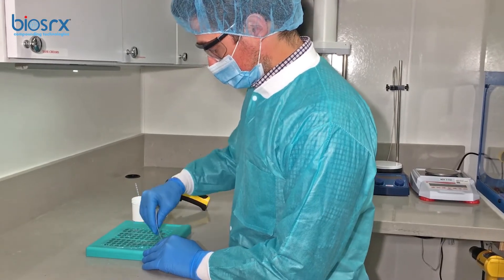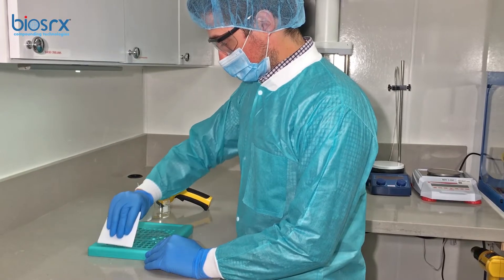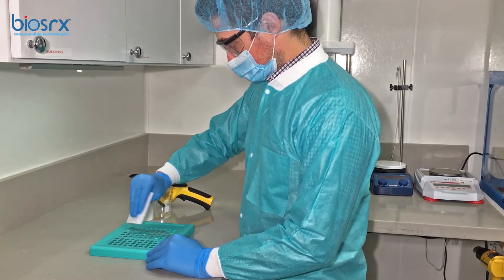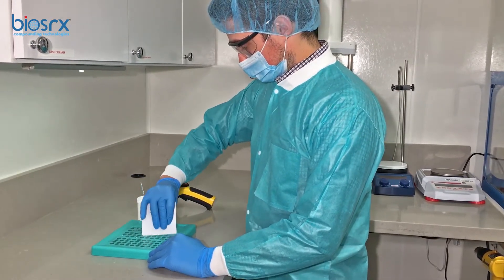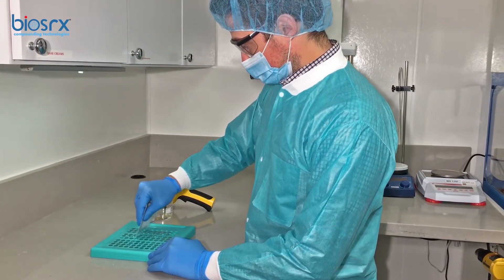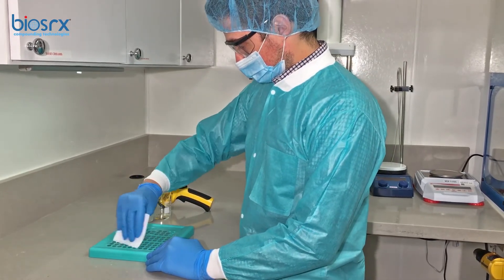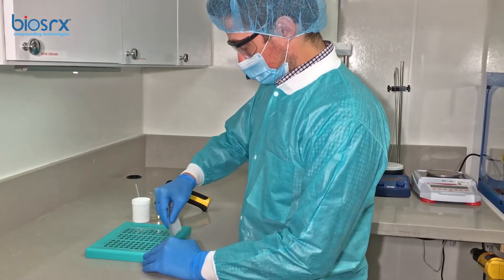At this point we want to pay attention to the corners, making sure every cavity is evenly distributed. Then we'll just do a swipe once every cavity has been filled — that way every cavity gets an exact amount.